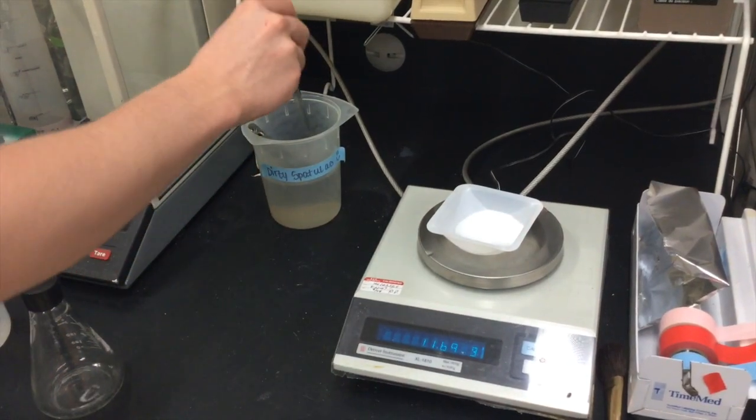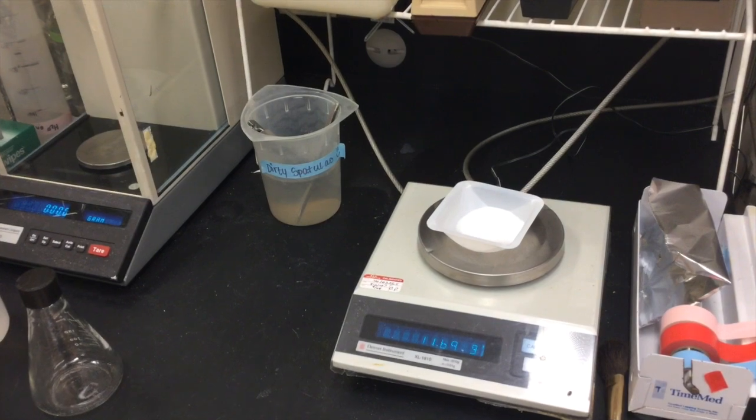Add and remove small amounts of the compound carefully with the spatula until reaching a precise measurement. When you are done, don't forget to dispose of the dirty spatula by adding it to its proper jar for cleaning.